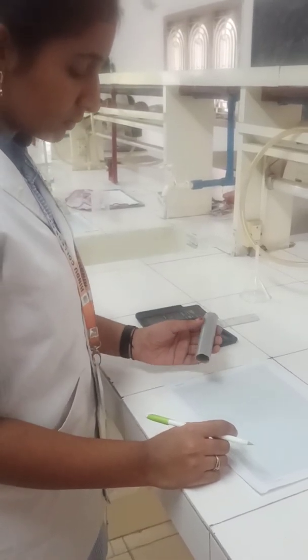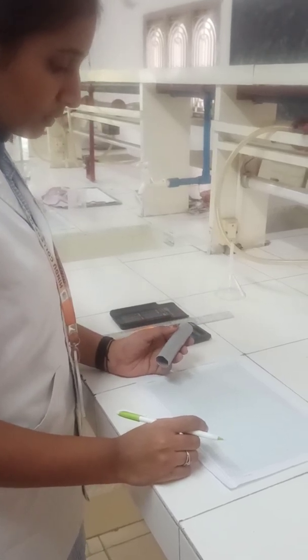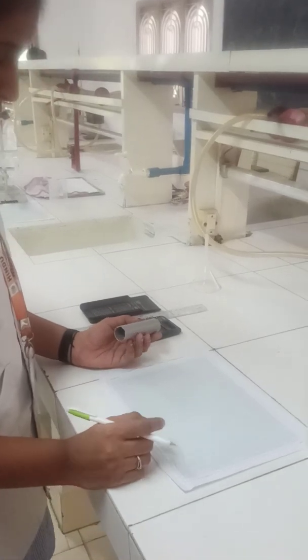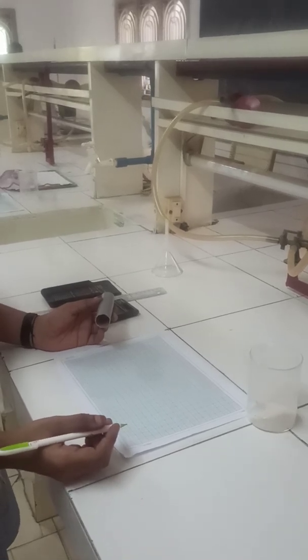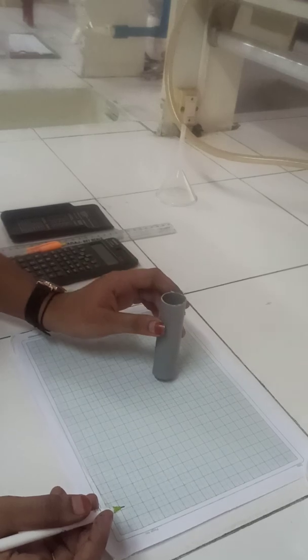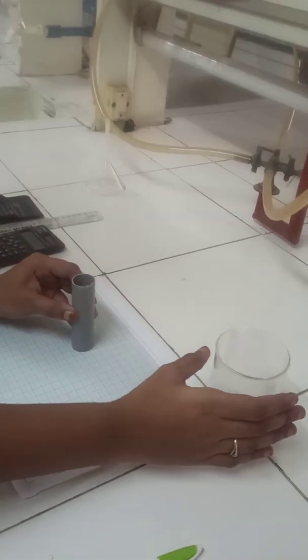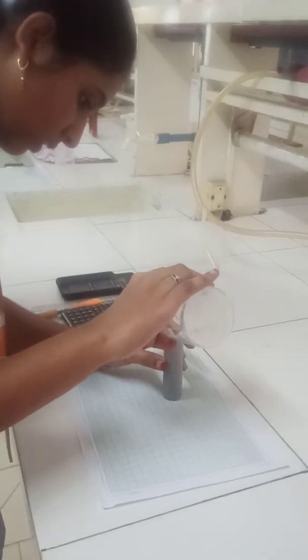Now we are doing flow properties determination — that is determination of angle of repose — by another method, which is the open cylinder method. In this method, take an open cylinder, one sheet of graph paper, and the sample. First, place the open cylinder on the graph paper and fill the sample into the open cylinder up to three-quarters quantity.